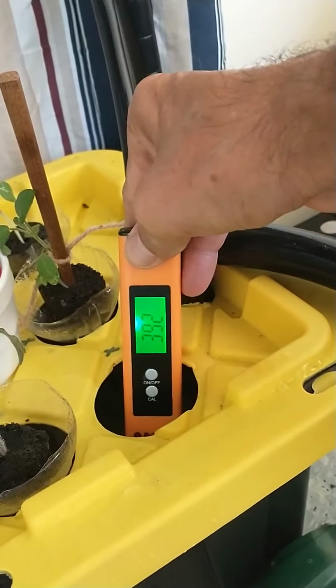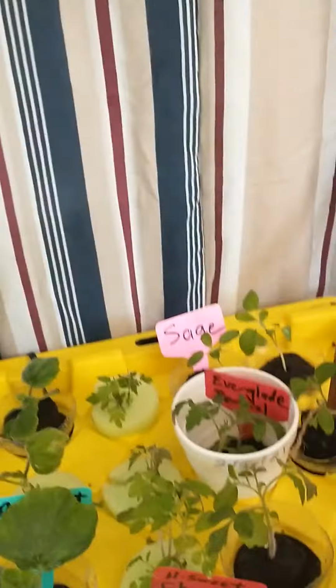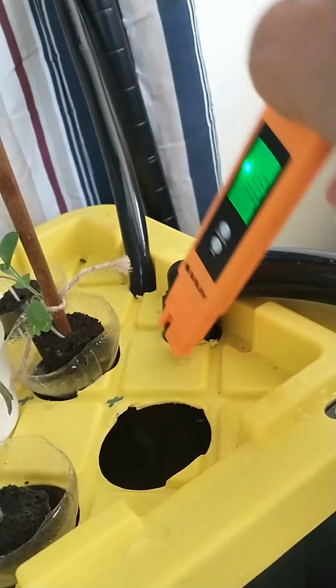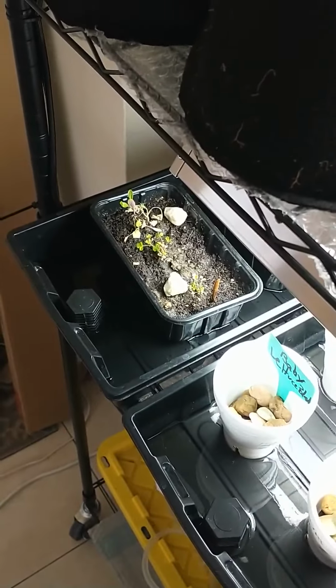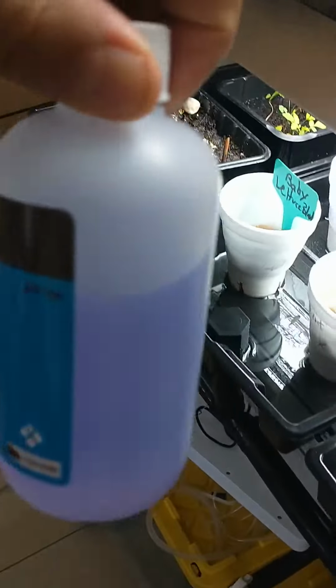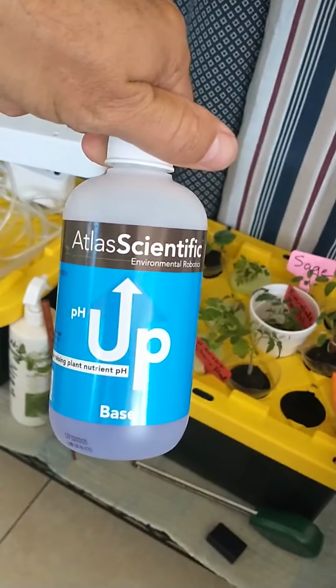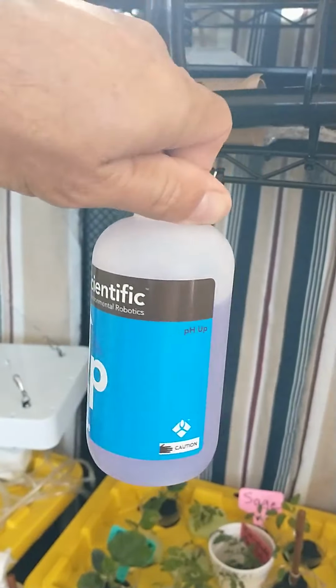Before I set up the other tank with the other light, I want to make sure that I can get this pH correct. At least when it's in the water, it doesn't go up and down as much. So I'm guessing that's right around where I'm at. And just to give you an idea of how much pH solution I actually used, look how much I used to get 5 gallons up. That's a lot. That's more than what I thought I should be putting.